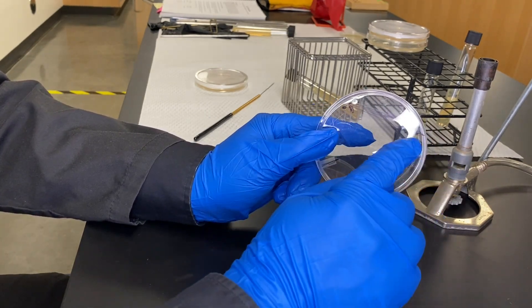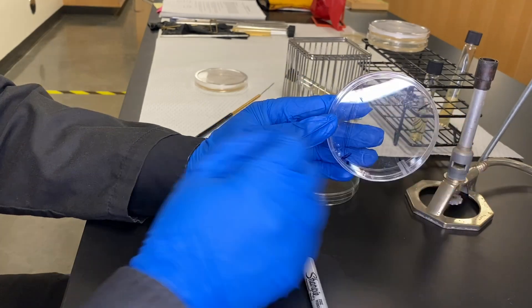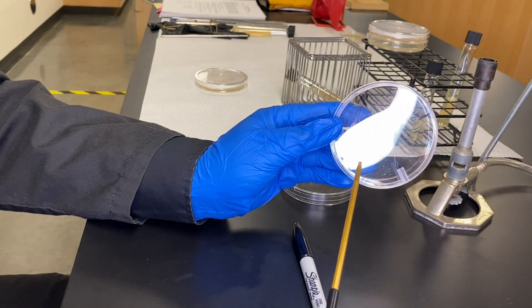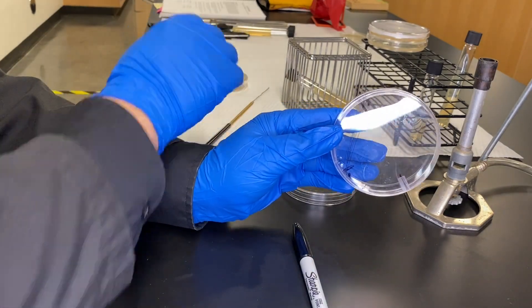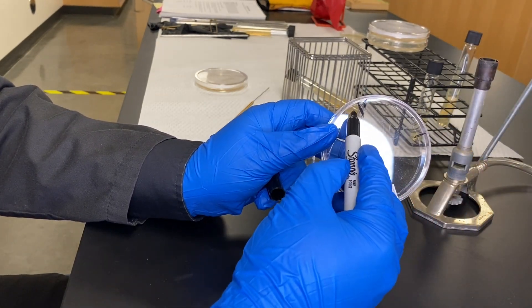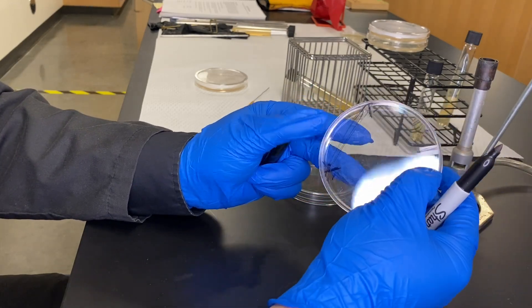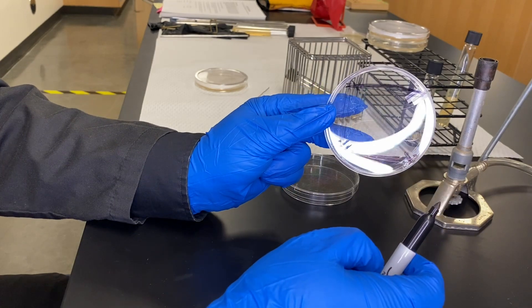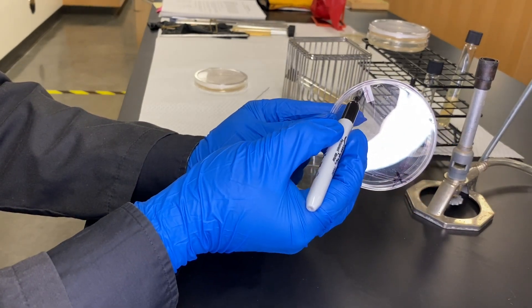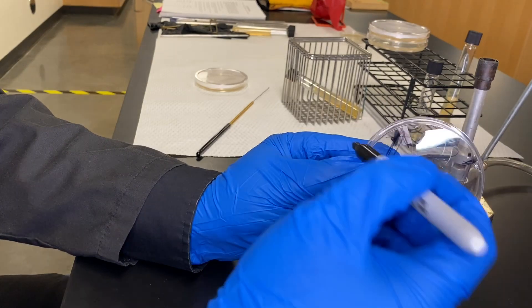You've taken a mixed culture and thinned it out a couple of times. Now that sample that is there, we're going to re-thin it — spread it a little bit more. So we rotate the plate 90 degrees, re-sterilize the loop for 15 seconds, then pick up some of what's already there and thin it out, making it less dense. We go from outside to outside again a few times — one, two, three, four, five — and repeat that same step. The very last one does not cross both sides; you just pick it up from the last streak and fish-tail it towards the center.